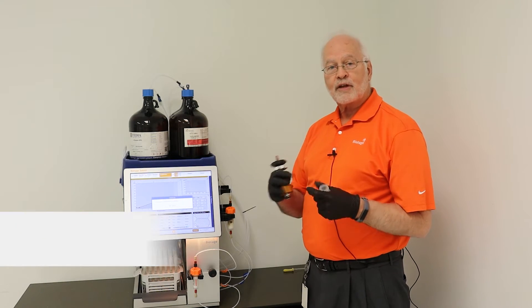So today's topic is external dry loading of your sample on a flash column.